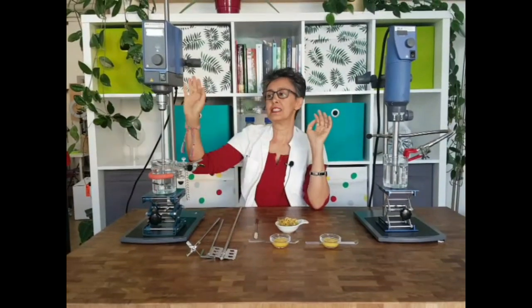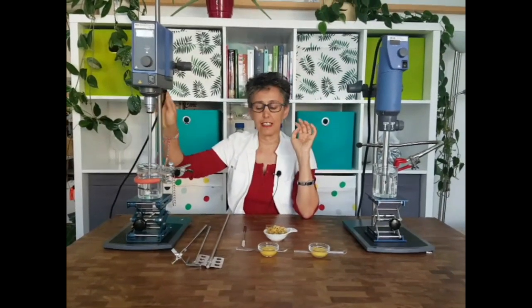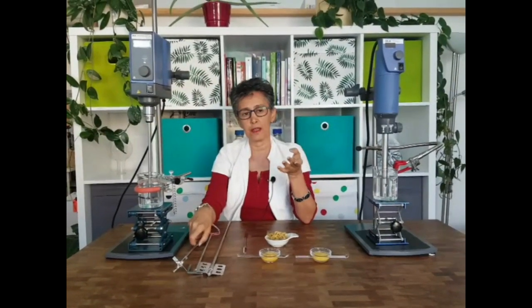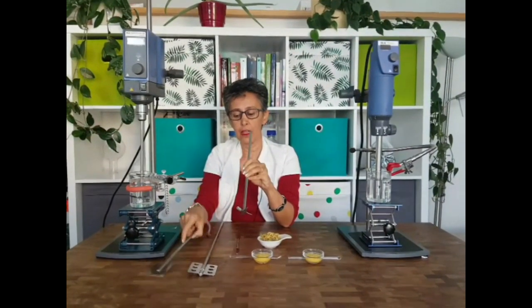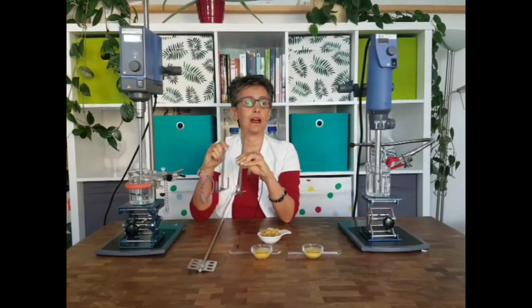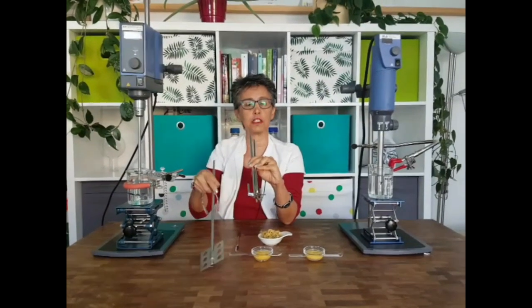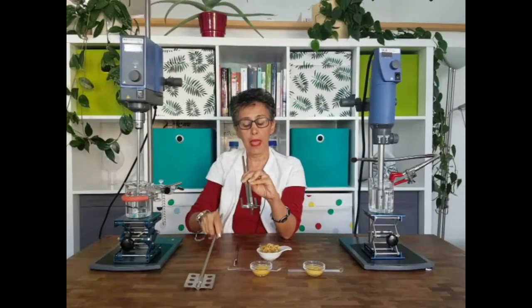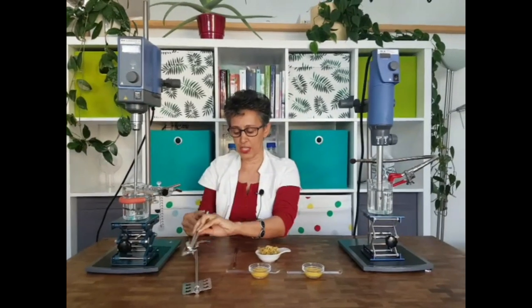This one here is an overhead stirrer. Depending on your needs and requirements, you can change the stirring blade for low viscosity, high viscosity, or for more agitation and introducing air into the product. You can change this.